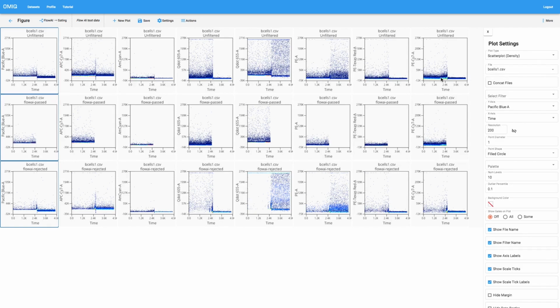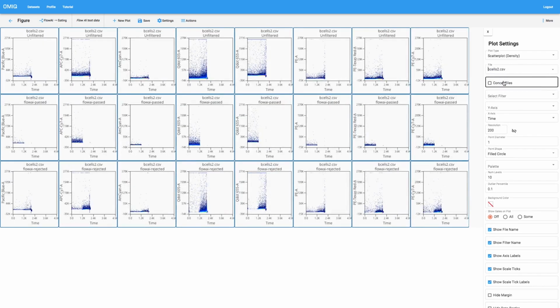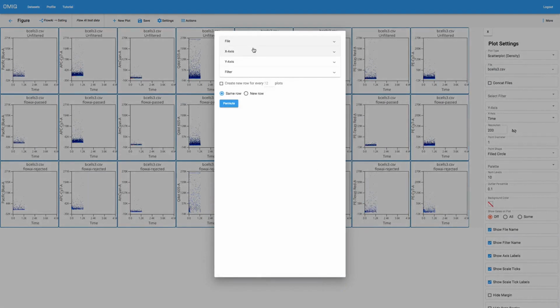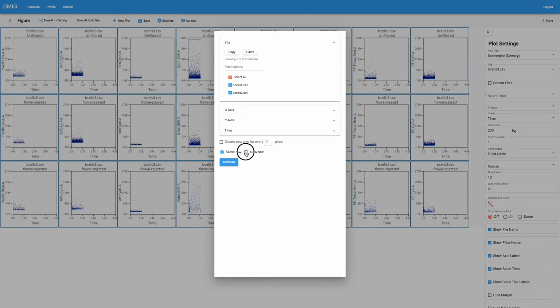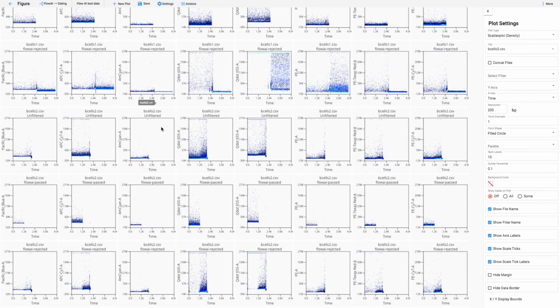And so now we're looking at all of our parameters as the y-axis changing in each column. And of course, we're looking at our three states of unfiltered, flowai-passed, and rejected. And we can just understand in different parts of the continuums of all of these channels, which data points got removed versus kept. And so this is a great figure to look at in terms of informing that understanding. And then of course what we can do is also change the figure such that it's looking at the different files, and we can interpret that one at a time. Or of course, we could expand this figure using permutation to also incorporate these other files, and we'll put those in new rows. And now we've got quite a big figure here, where each of these 3-row blocks looks at a different file.